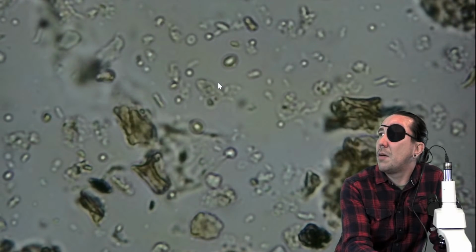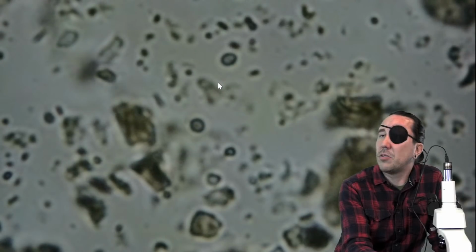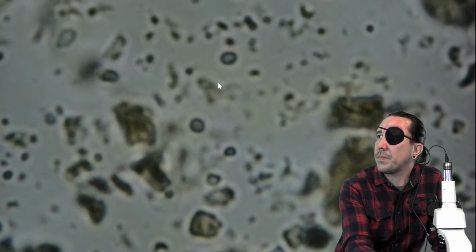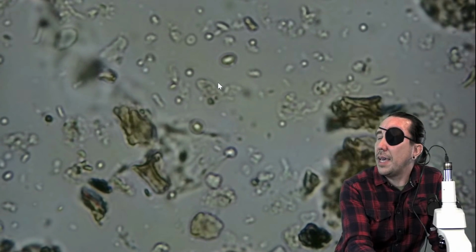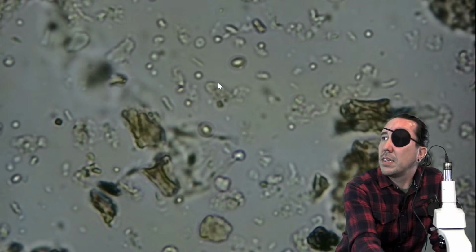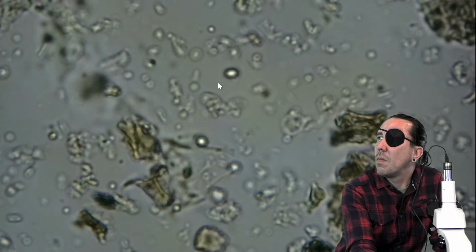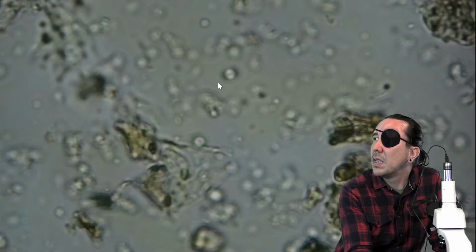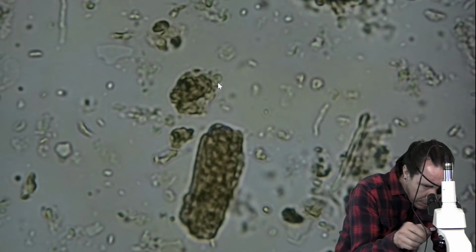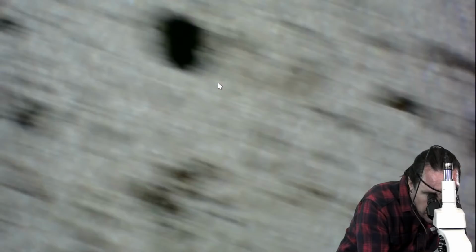As far as protozoa, I usually want to see at least an average of one per field of view for good soils and compost. And I said an average, so say you have 3 in one field of view and 0 in another. I'm going to flip out here and see if I can see some more fungi somewhere else real quick. Zoom through this microscope.